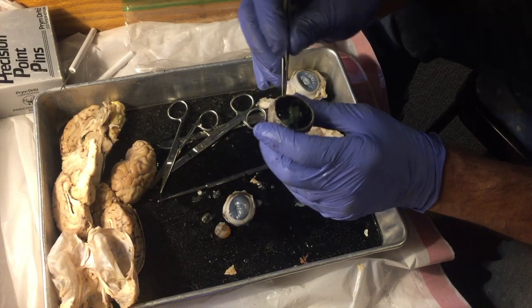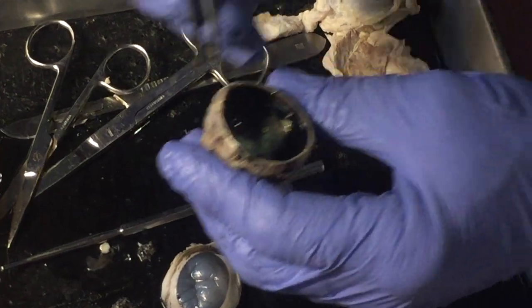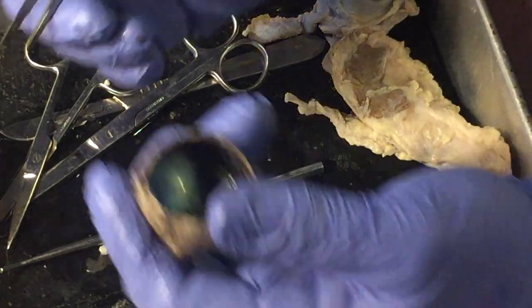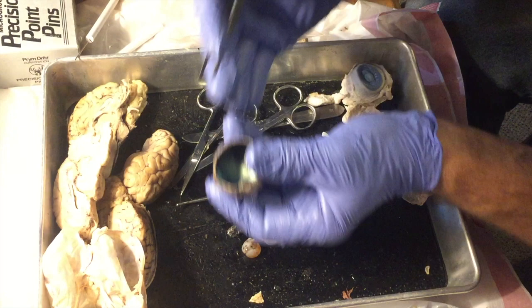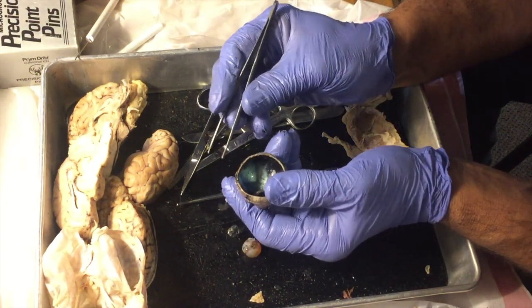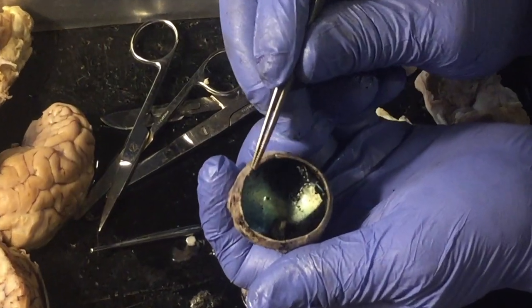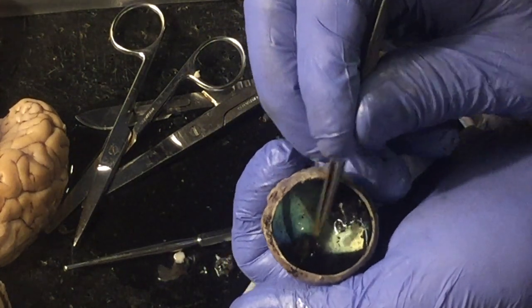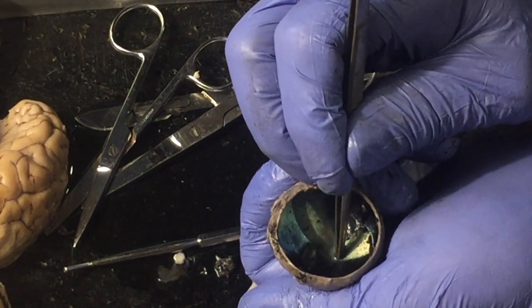Yeah, there's another spot here that cows don't have because they don't read, that humans do. If you ever think about it, if you pick up something to read it, where do you hold it? You always hold it right in front of your face. Try to hold it the same distance away from your eye, but move it off to the side, and you can't read the print. You can see it, but you can't focus on it. What you are doing when you hold that thing right in front of your face is focusing that image on an area very near the optic nerve, but off to the side of it, in the back of the eye, somewhere like here, called the fovea centralis.